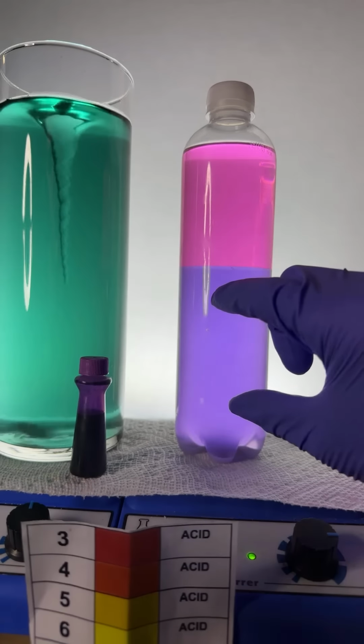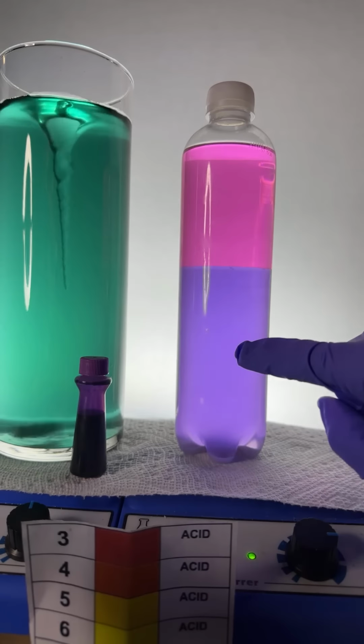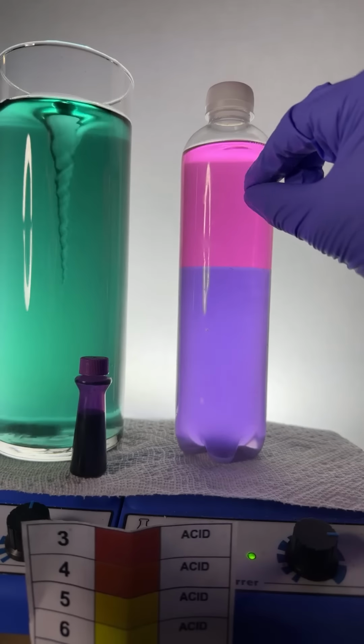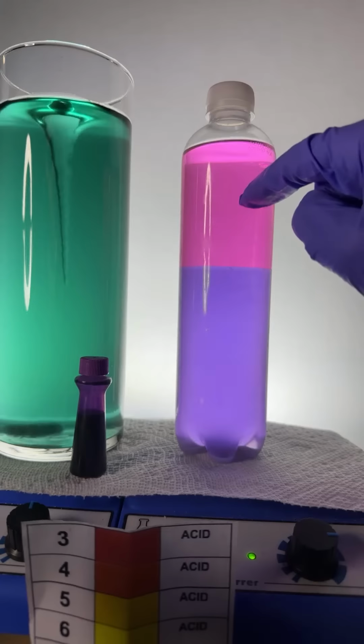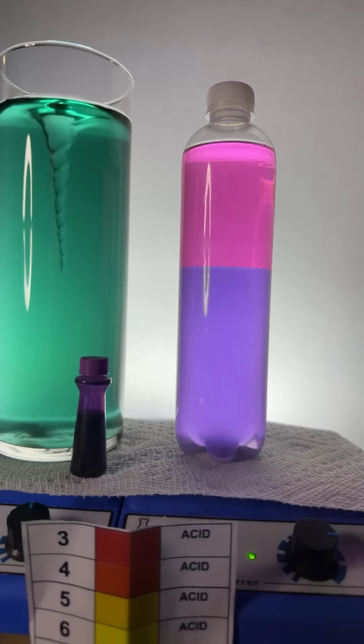They combine exclusively, and that pushes the acetone out. The attraction between the acetone and water is not strong enough to overcome the attraction between the salt and the water. And that's why you get the separation of the two layers.